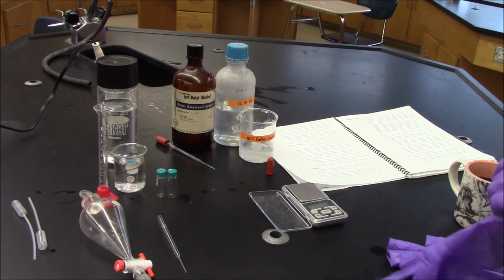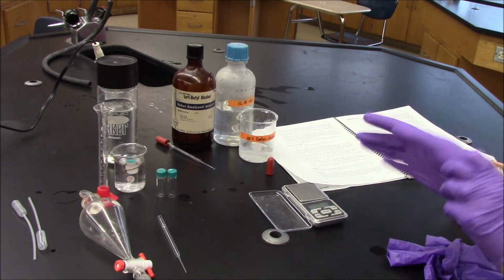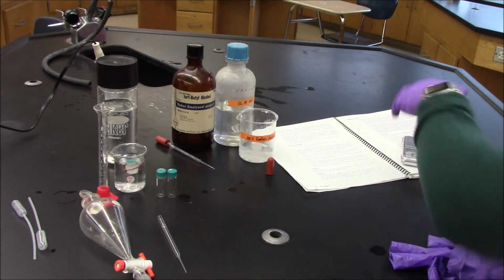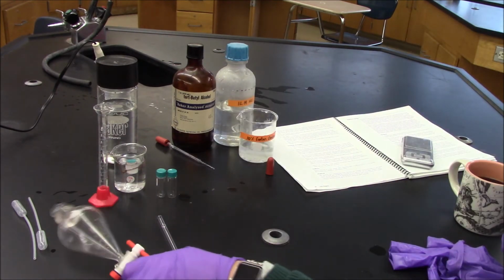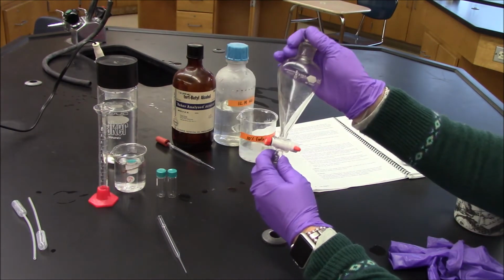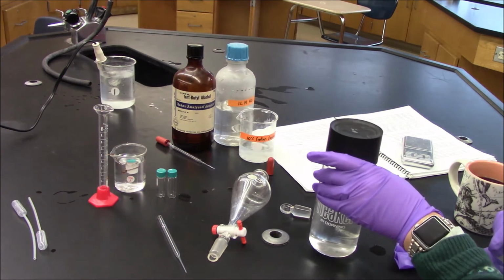Okay, I'm putting gloves on, not for the next step, but for the steps after that. What it says now is that they want you to use a test tube and a cork stopper, but I know from previous experience it doesn't really go so well. So I'm going to try the sep funnel today, see how it goes. What they want me to do is add 5 to 10 mils of cold water.